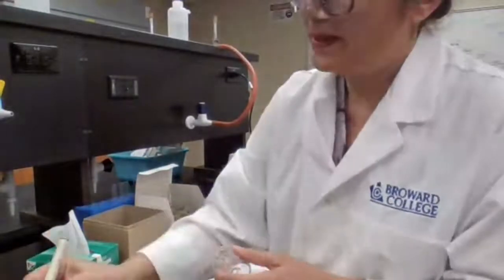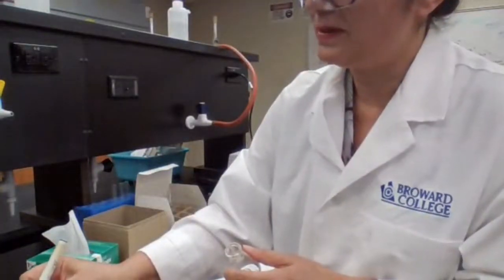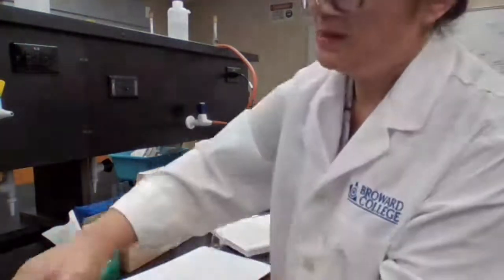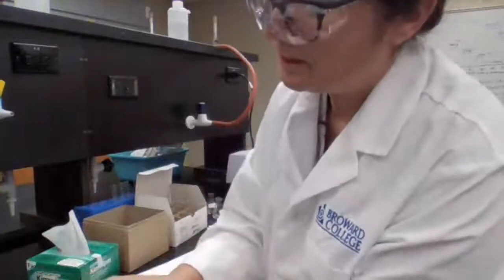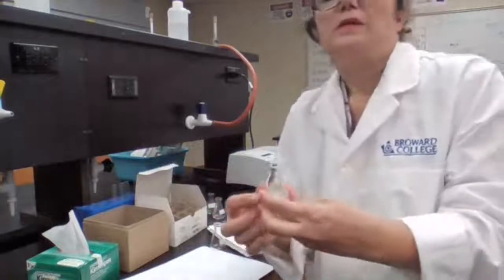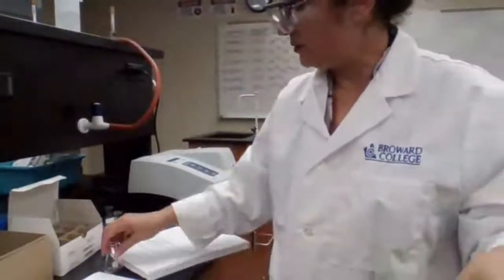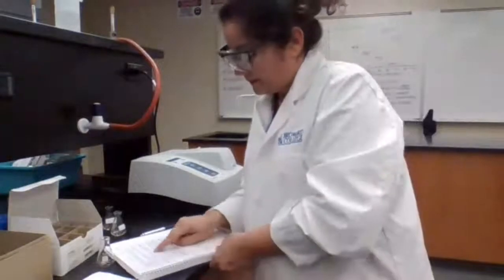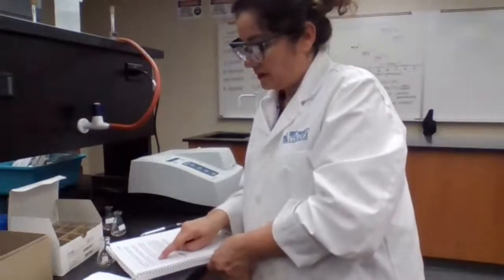So I'm going to make my unknown. I have 1 minute time. I'm trying to see if I can make my unknown A. Unknown A. So let me know if it's 2:09. I have to get ready for this, okay? 2:09, I have to place my sample in. I cannot wait. So for 2:09, it's 5 milliliters of each. Unknown A.